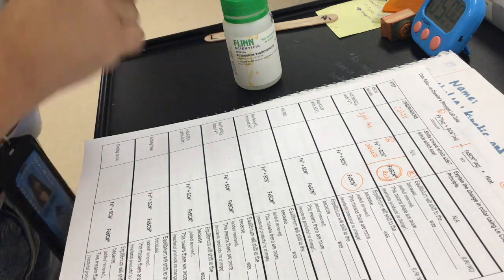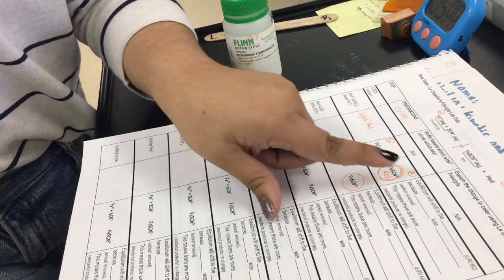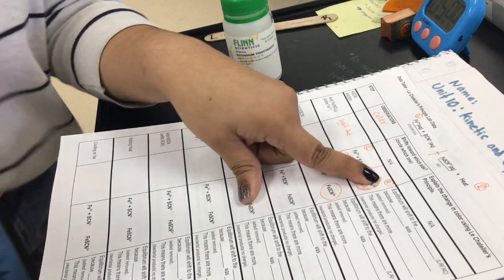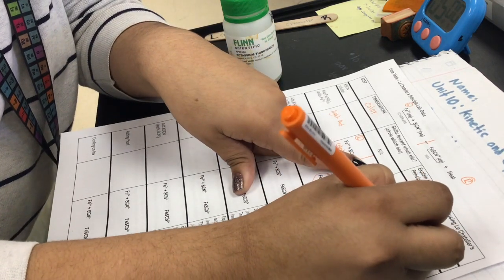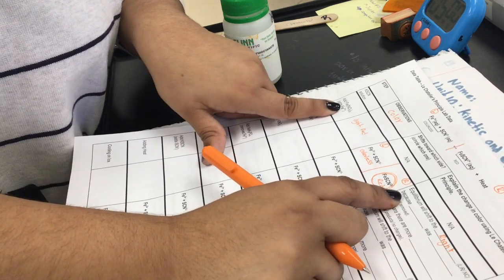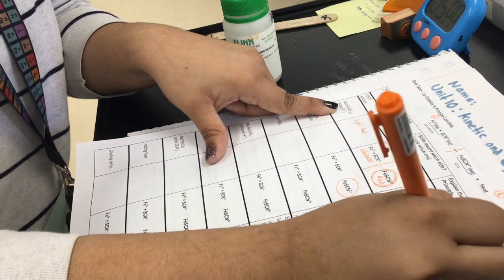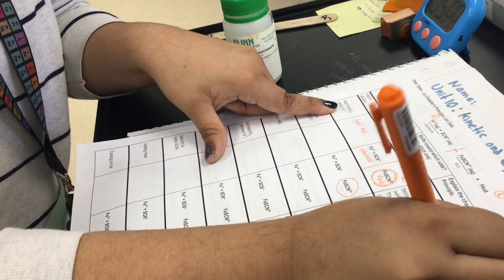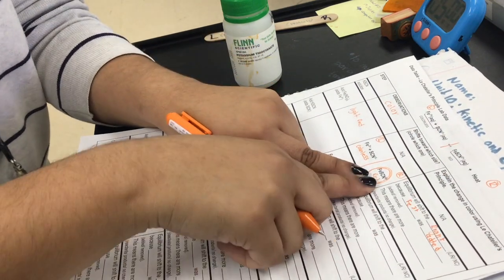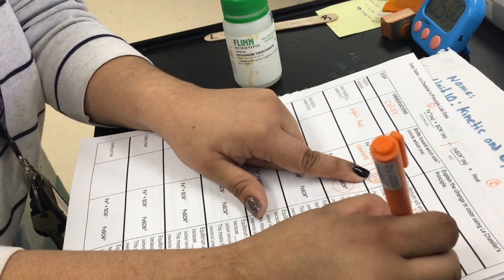So, light red. So equilibrium will shift to the red. Is that the left or the right? The right. Because, what happened? Why did this occur? Fe3+ was added, which means that there are more, if it's red, do we have more reactants or more products? We have more products.